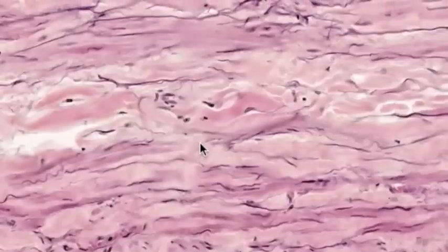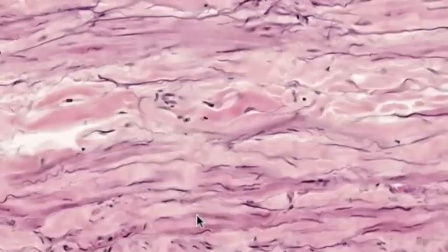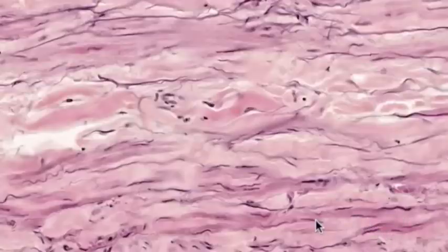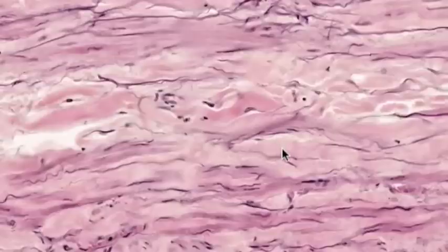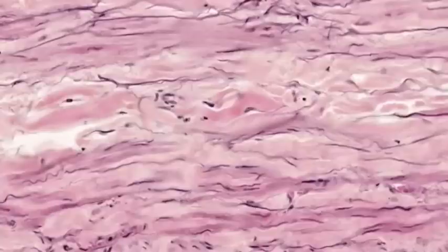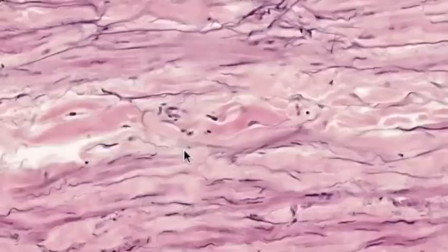Outside that layer of longitudinally oriented smooth muscle, the bulk of the tunica media in the IVC is made up of moderately dense connective tissue — mainly type 1 collagenous connective tissue. Some smooth muscle cells are embedded among this collagenous connective tissue with a roughly circular orientation, but they don't form well-organized bundles. There is a very large amount of pink homogenous-looking collagenous connective tissue between individual smooth muscle cells. Additionally, there are elastic lamellae in the tunica media, seen as intensely dark stained lines, with the most distinct being the internal elastic lamina. That concludes the wall structure of the inferior vena cava.